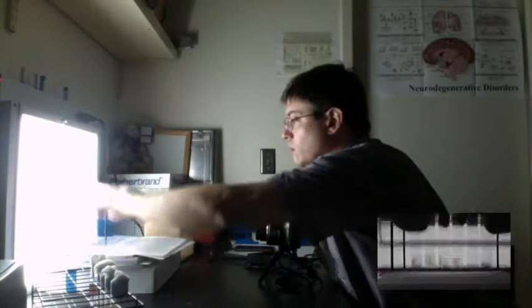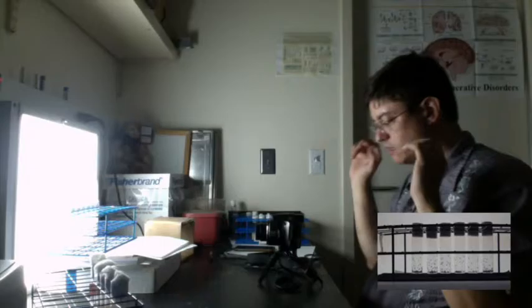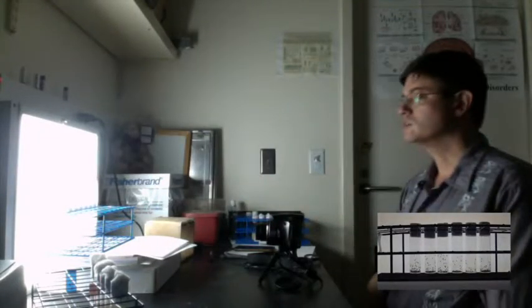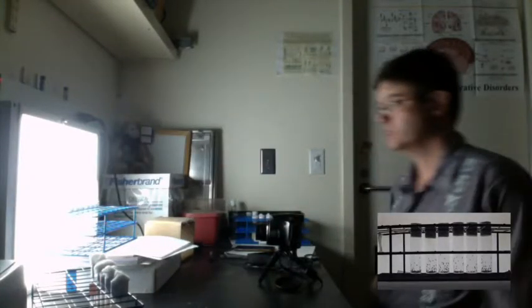Doesn't really matter though. So one thing that's important is that after I tap them down, I have to remove my hands and let go completely and let the flies just sit there, because the program needs to have a stable image in order to do the proper calculations. Every time I put my hands into the picture, the program will detect that and use that to segment the video into individual runs of the flies. So you let the flies climb for up to like 3 or 4 seconds, because once they start getting to the top, then they bunch up there, and the results are no longer very interesting.